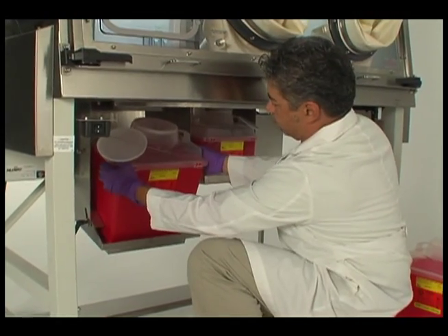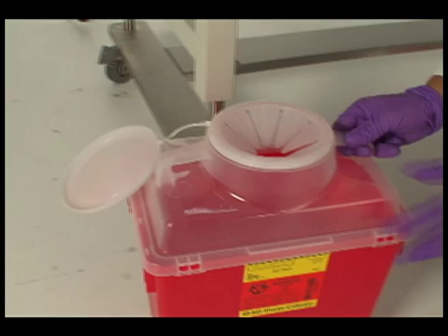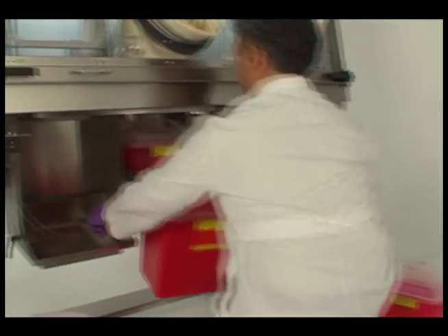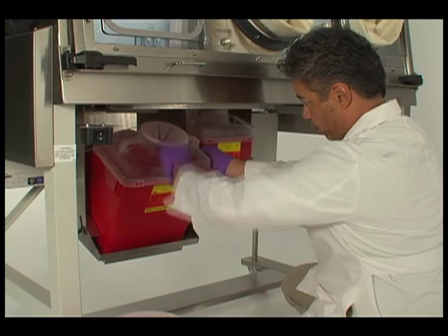Plastic bags may be used with the waste container as needed according to SOP. Apply even pressure to the container's lid to lock it into place. Place the sealed containers aside and place a new one on the waste receptacle tray beneath the isolator.